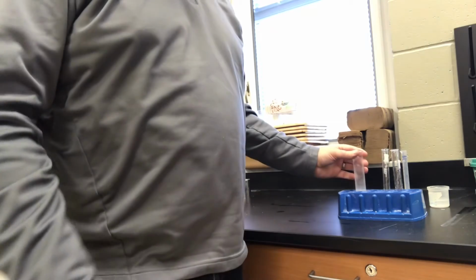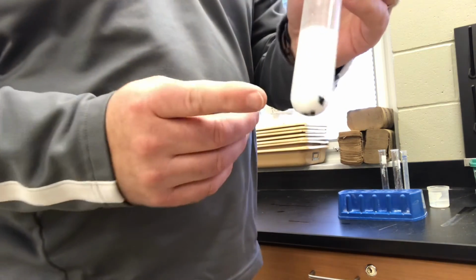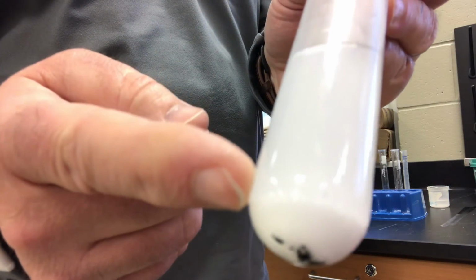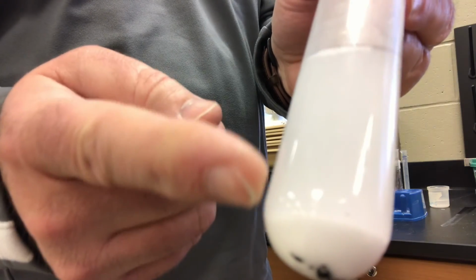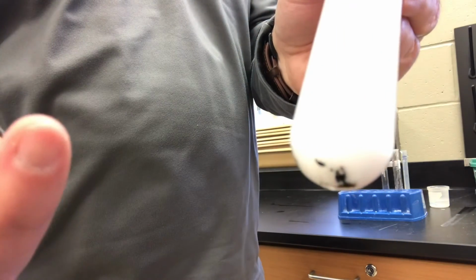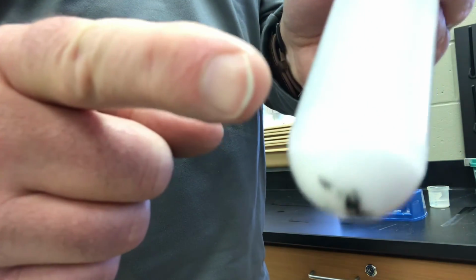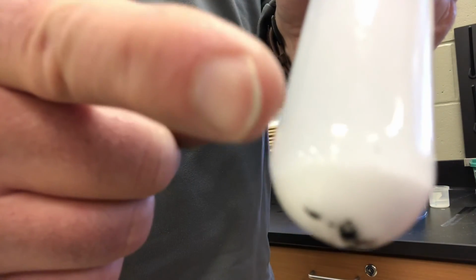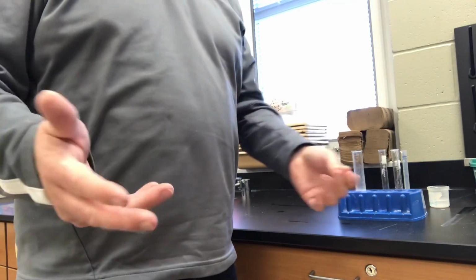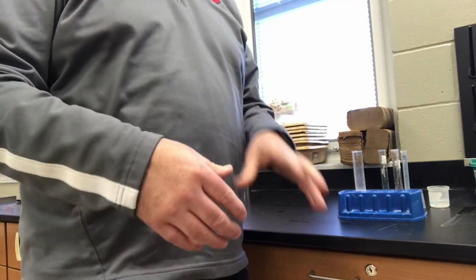What I'm going to show you now is going to be a little difficult to see, I understand, it's not perfect. At the bottom of this test tube, and it's not that black stuff, you can see the cloudy solid that has formed at the bottom of the test tube. I know that this liquid up here is still a little cloudy, but if we gave it even more time, we've gone about 7 or 8 minutes, we would start to see even more of this precipitate, this solid that is formed out of solution. So, an example of evidence that a chemical reaction has occurred is what we call a precipitate. It is one example, and a precipitate is when a solid forms out of solution.